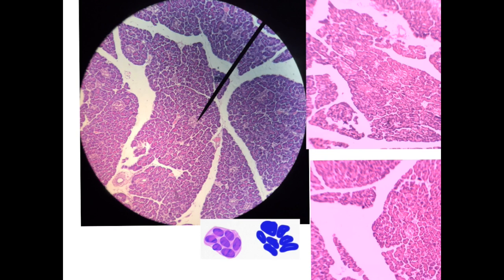Another lobulated slide, which is the pancreas. The pancreas very similar in appearance to the parotid, but you will compare between them. As you see here, the septa are very fine, so they are cut, leaving white spaces, but the septa in the parotid are thick and they are still present and stained by the red coloration. The most important than this thing is the appearance of the lobules under the microscope.